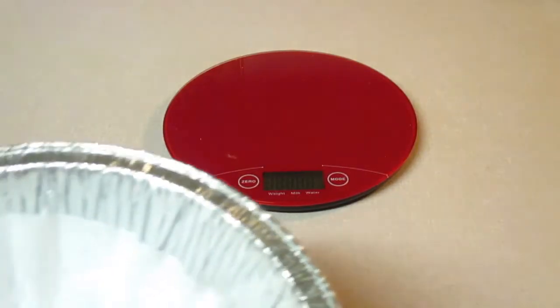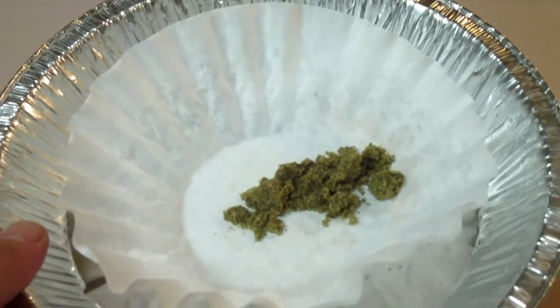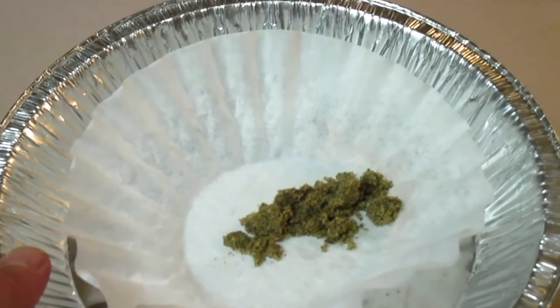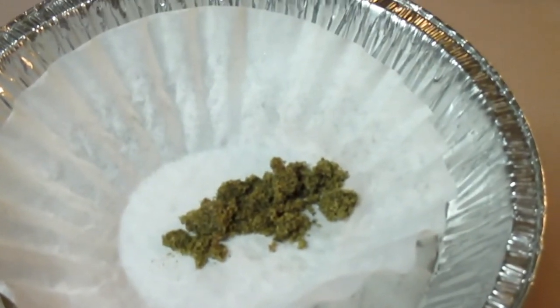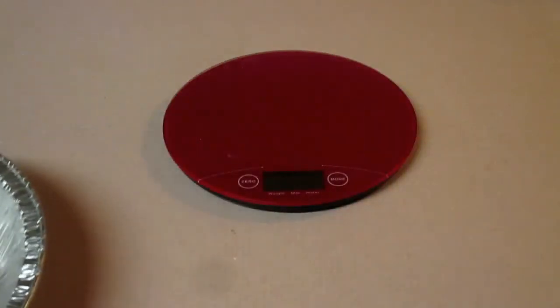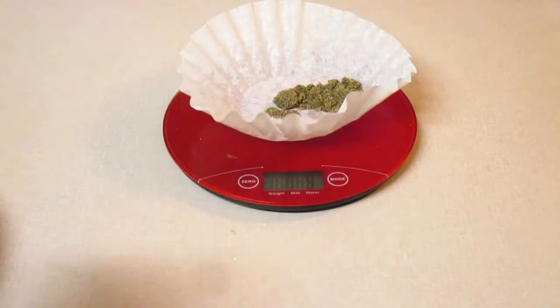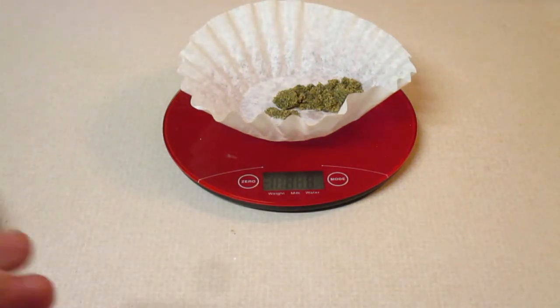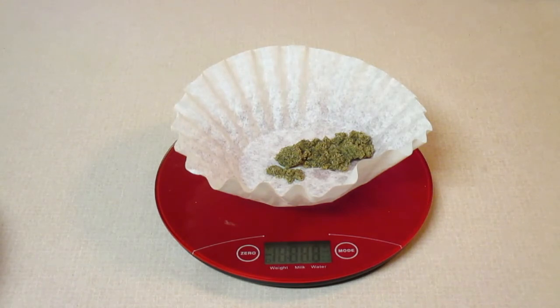Alright, now that we've taken the sand out of the oven, it is now completely dry. It's been drying for about 25 minutes at 250 degrees Fahrenheit. What we can do now is mass the filter and the sand. So we're going to get a mass of the filter and the sand. Be sure to turn your scale on and to tare it before you do this.